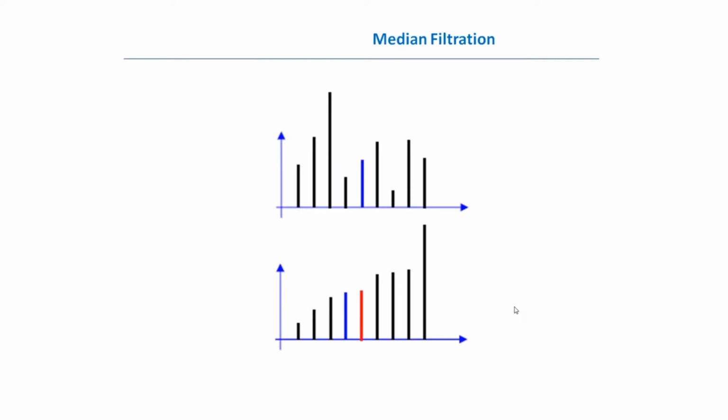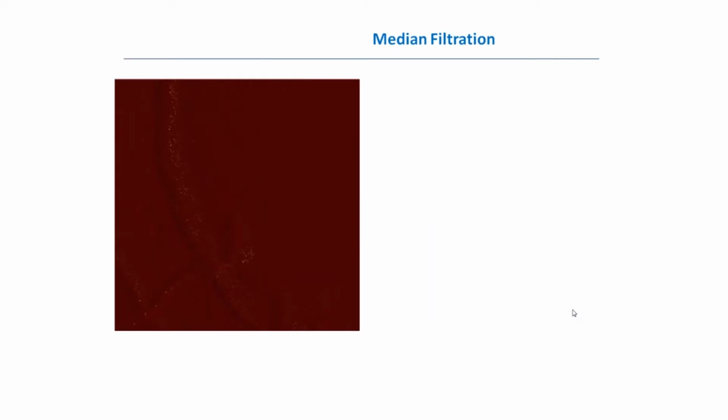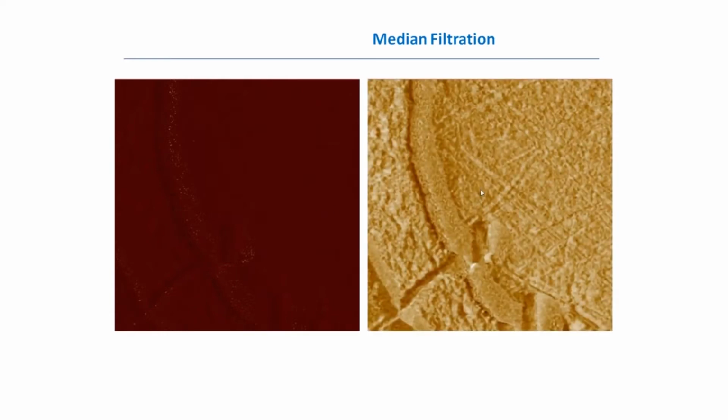That means that if we have some spikes on the image, this filter will eliminate the spikes. As an example, there is an image where we can guess that there is something, but due to multiple spikes, positive and negative, we don't really see the details. We don't see the information, we see the noise. And if we apply the median filter, that's another story. We can see all the details and the spikes are eliminated.